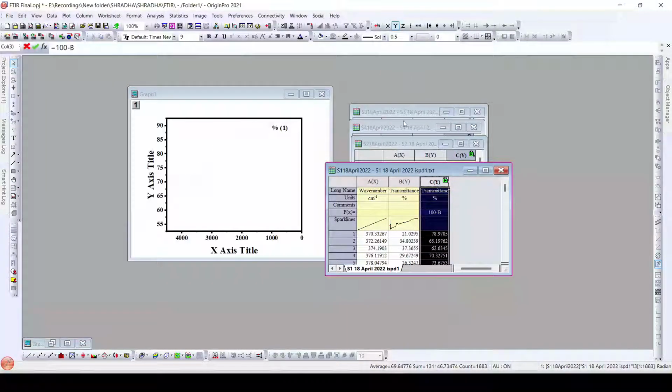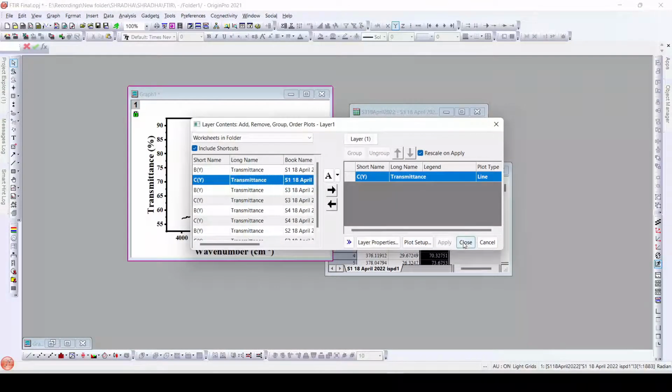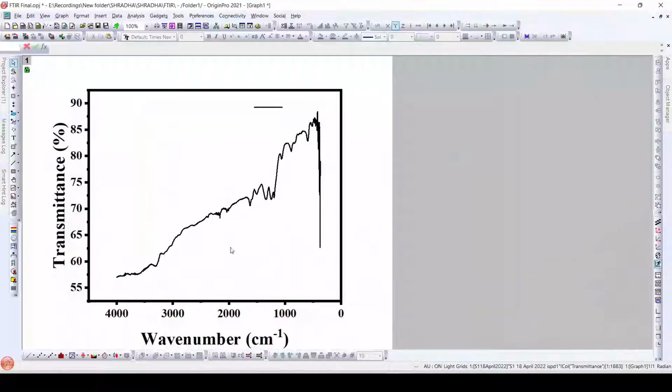When we plot this data, as we will do here, we can use this C column, apply. Once we apply this, we can see this here. This is the transmittance data, that is, here we have 90 and here we have 55, it is decreasing, or this can be considered as the transmittance data of Fourier transform infrared spectroscopy. And here we can see different peaks that we do have. Okay, so as we can see from this data, it does not have a particular baseline.